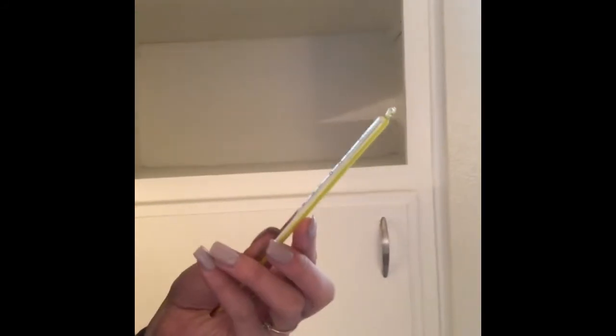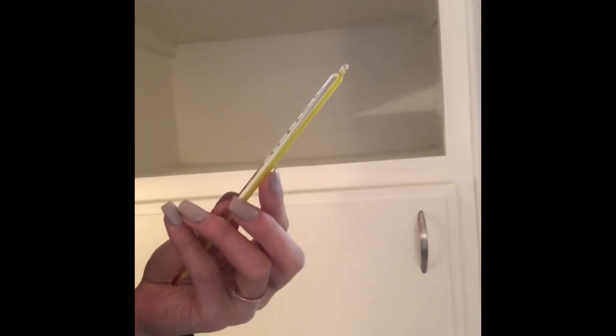I put a thermometer in there to check the temperature of it, and it is 21 degrees Celsius, and therefore that's going to be good for my incubation spot because it is between 21 and 25 degrees Celsius, and it is above 20 degrees Celsius. It's in a dark location. It's a cabinet. There's no windows nearby or anything.